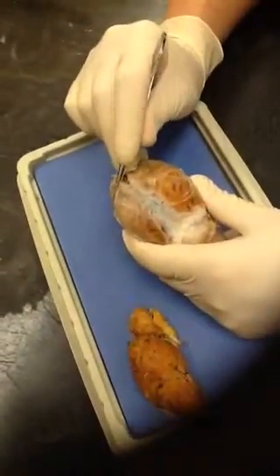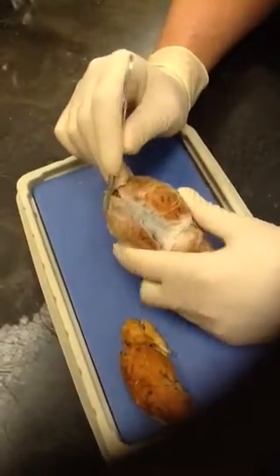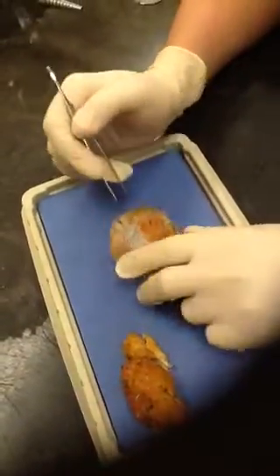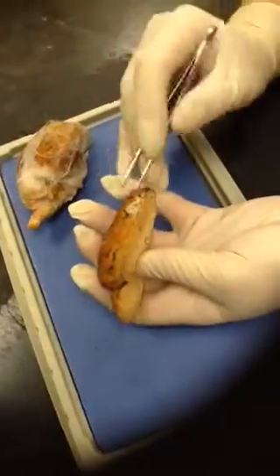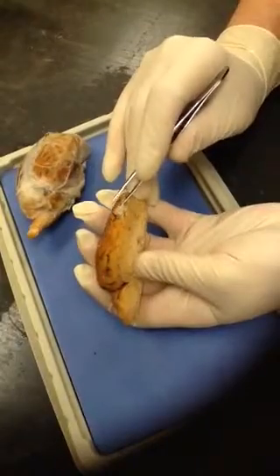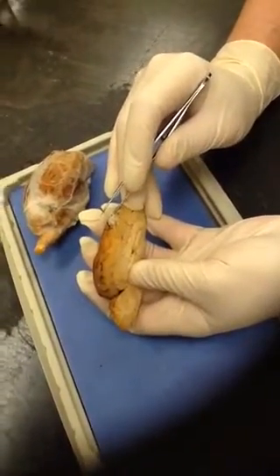The first one is this big thick one right on top. It's called the dura mater. Okay. It's kind of a protective layer, really protects the brain itself. The second one that you have to know is the pia mater. Okay, so it's this very thin membrane that's actually connected to the brain itself.